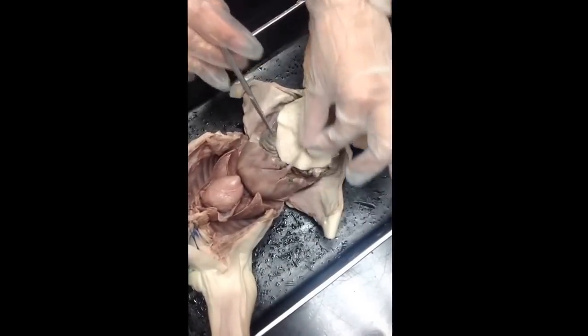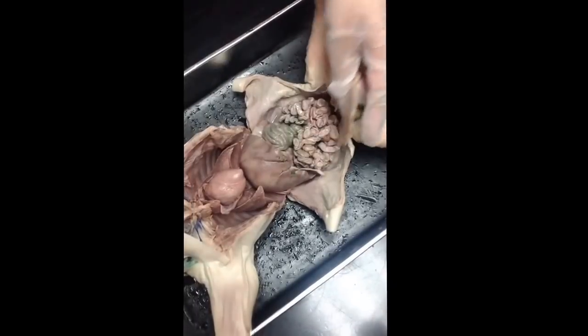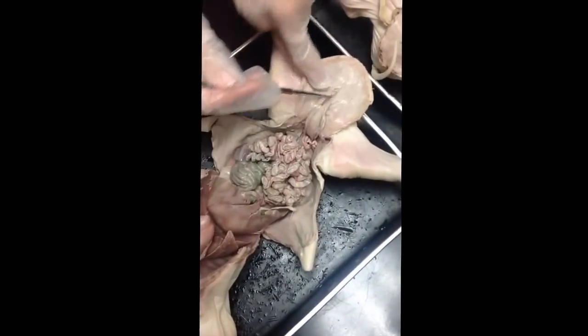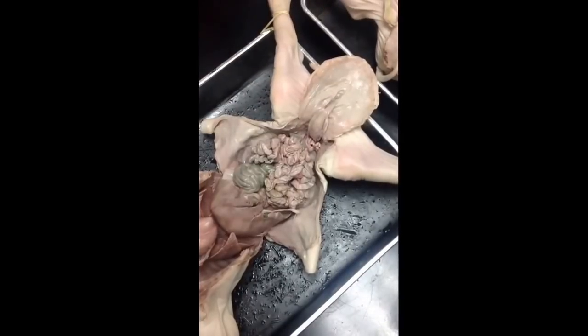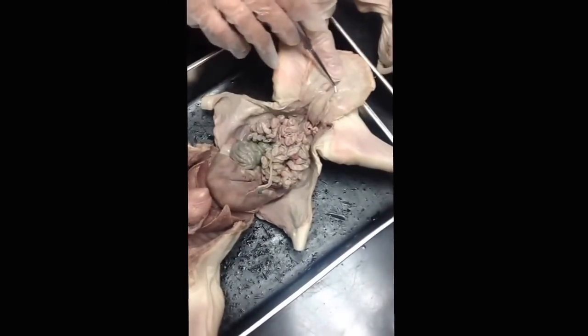The oxygenated blood will enter into the umbilical vein, will go towards the heart. Once you're done with the blood, it will then exit into the umbilical arteries, back out towards the placenta. So one umbilical vein, two umbilical arteries.